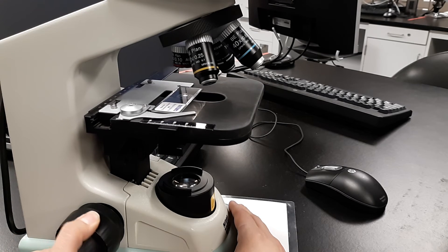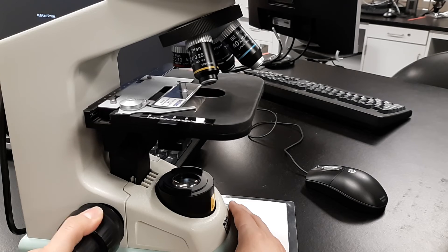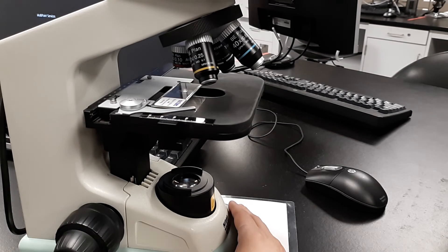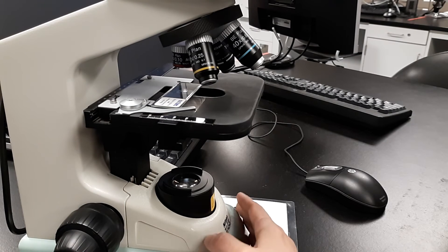Remember the top-bottom method only works on red. You don't want to use it on other objectives because you could smash the slide into the objective lens.